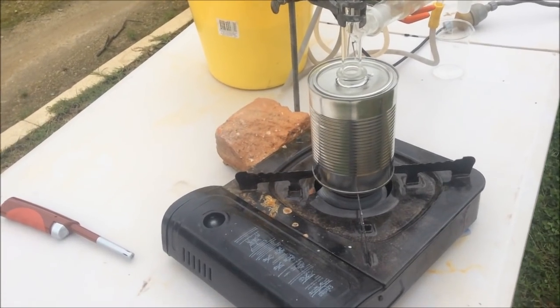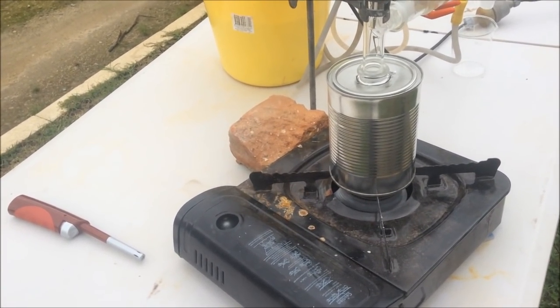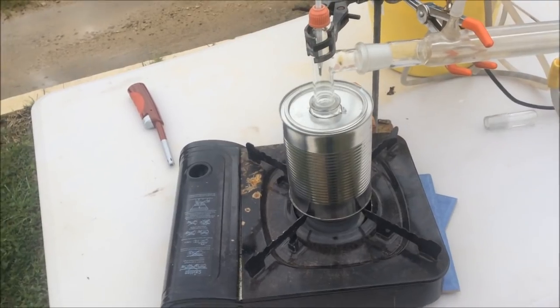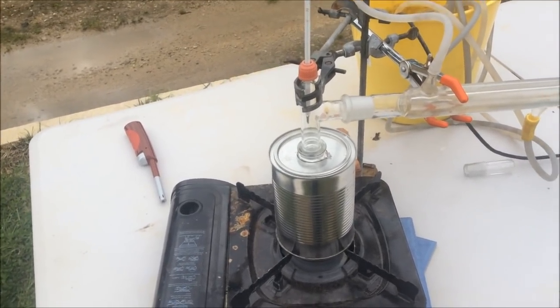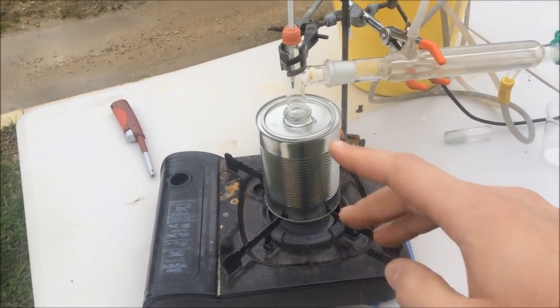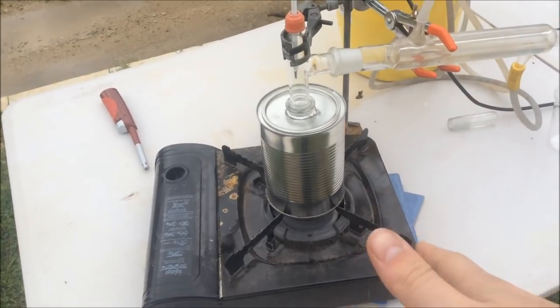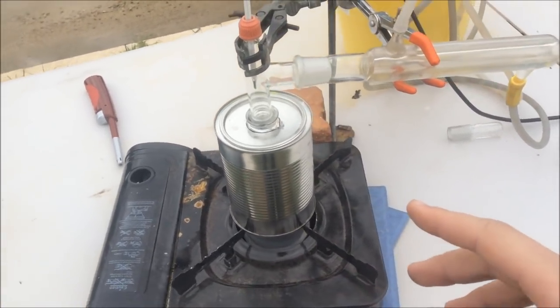It's been going for about 30 seconds, and now you can already hear it sort of starting to boil at the bottom there. So this is a lot more aggressive way of heating it. We're still obviously going to try and hit that 20 degree sort of window between the boiling point of ethylene glycol and the melting point of sodium hydroxide, which should still happen because it should still boil off the ethylene glycol before it melts the sodium hydroxide.